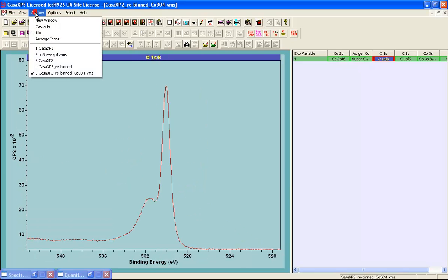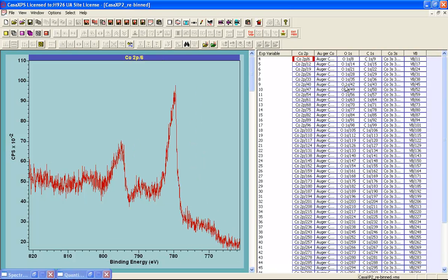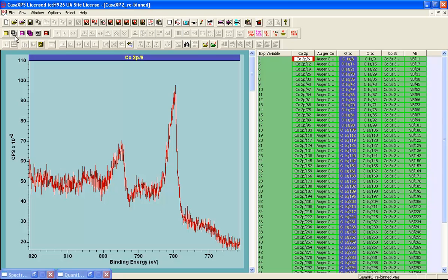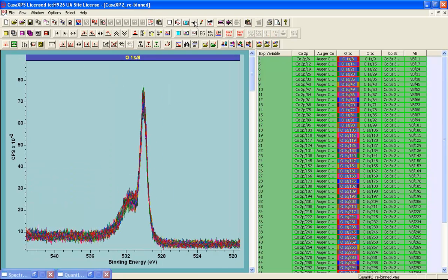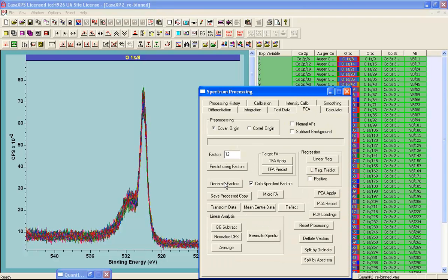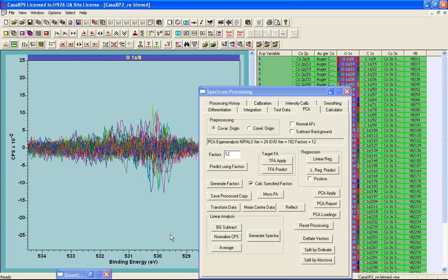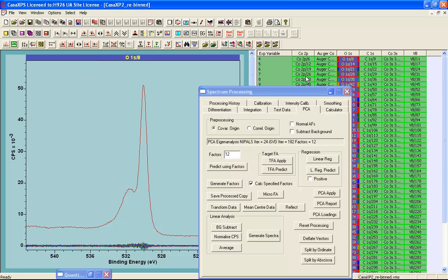Just to conclude, we'd like to demonstrate that these data that have been rebinned actually contain no artifacts due to charge compensation. So first, let's look at the oxygen. And if we go to the spectrum processing and the PCA property page, and then generate factors, we can see that the abstract factors that are calculated based on these oxygen data have almost no information in them other than noise. So that's good. That suggests that the oxygen was calculated correctly.